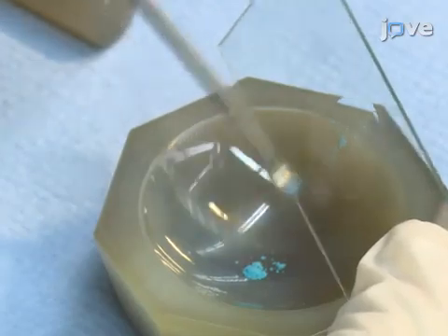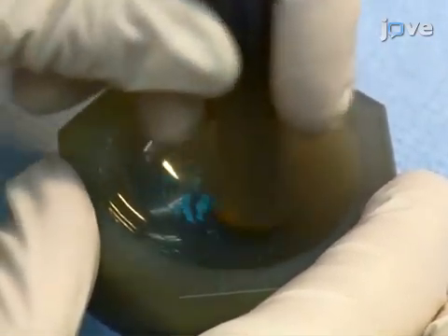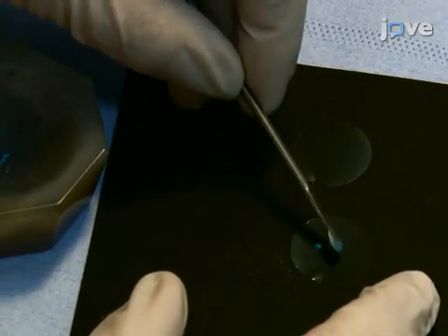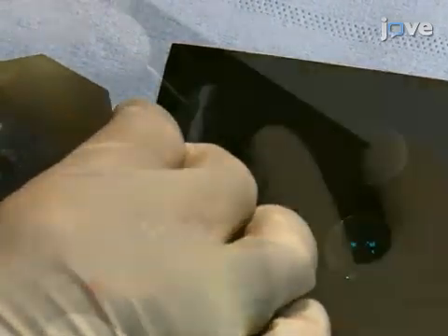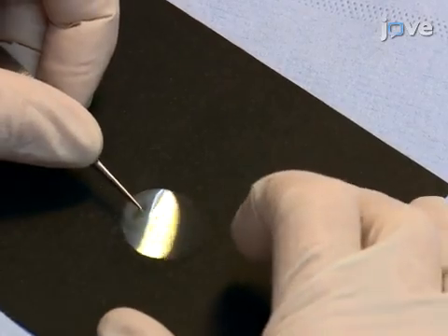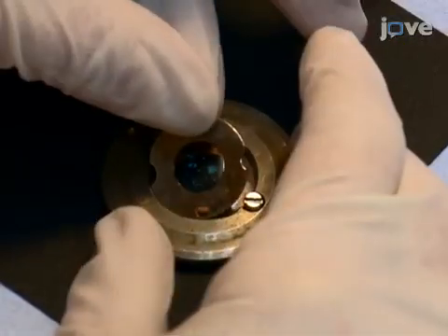Following this, grind the sample carefully with a pestle in a small agate mortar. Then distribute the sample between two thin X-ray transparent polyamide foils, and mount them on a transmission sample holder with an 8 mm diameter central opening.